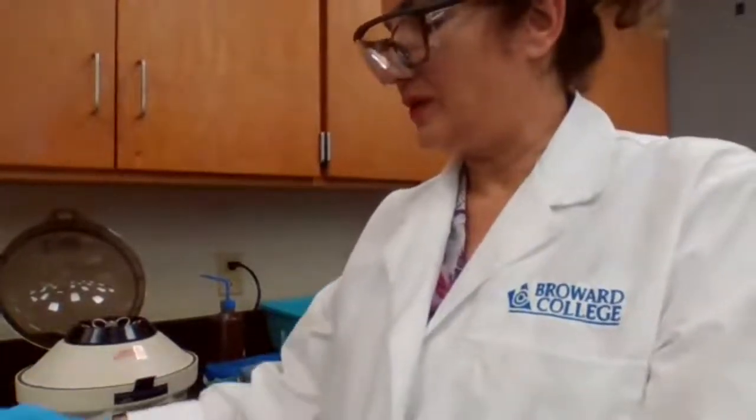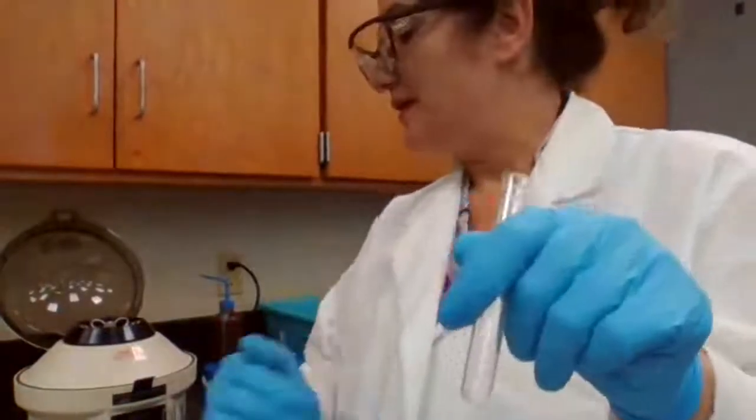So we're going to add ammonia. What happens when you add ammonia? The manual does explain with the chemical reactions why this is going to dissolve. The complex that is forming here is going to be aqueous. The ammonia complex of the ion that is forming is aqueous.